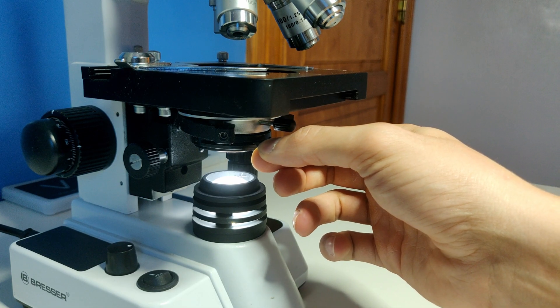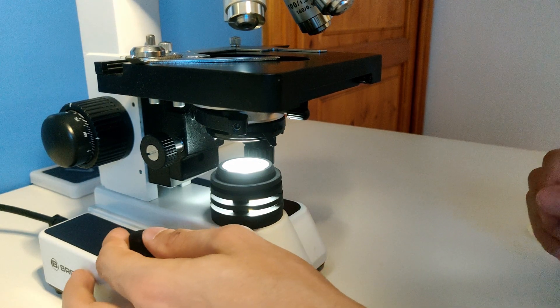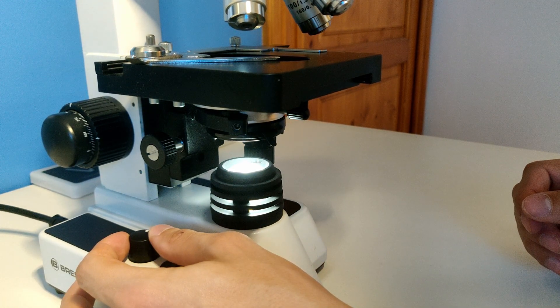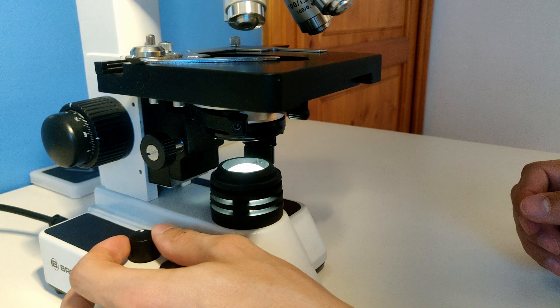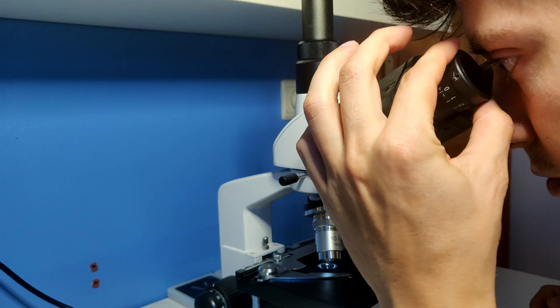The image now has sharp edges and is neatly in the middle of your field of view. Now open the diaphragm further until the edges are just outside your field of view. What you see now is a typical wide circle and the microscope is set correctly. You can adjust the light intensity using the light button at the bottom of the microscope. You may need to adjust the ocular lens to compensate for any differences between your eyes.